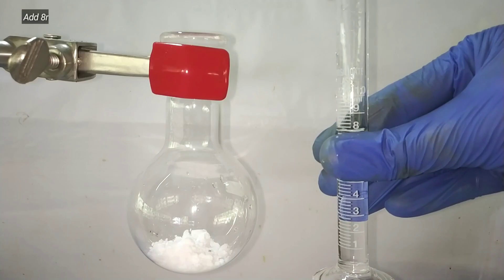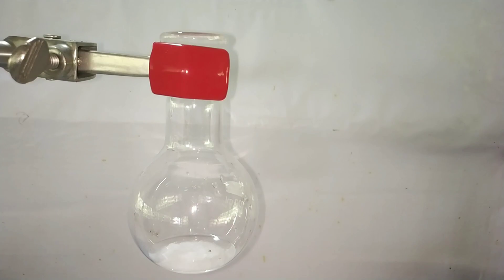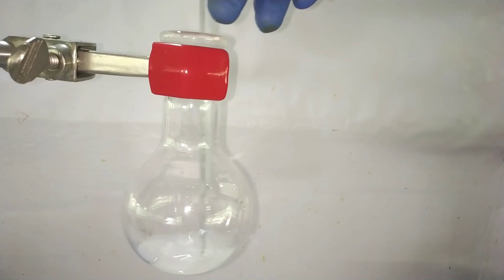Now add 8 milliliters of distilled water to the thiamine in order to dissolve it. The compound is pretty well soluble in water. You can use a glass stirring rod or preferably a magnetic stirrer to dissolve the compound completely in the water.